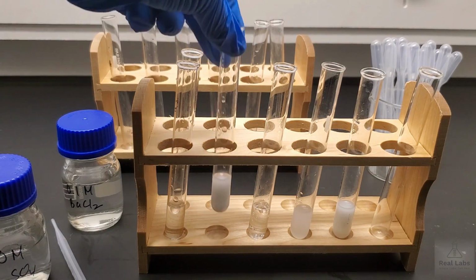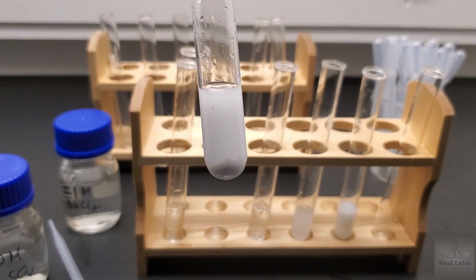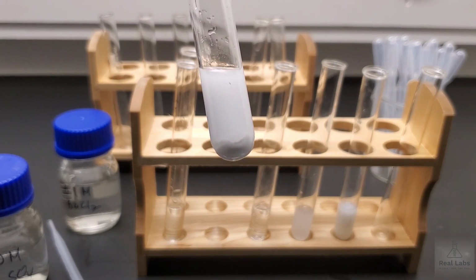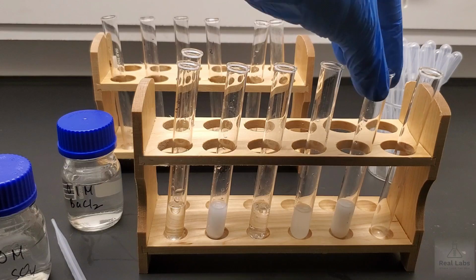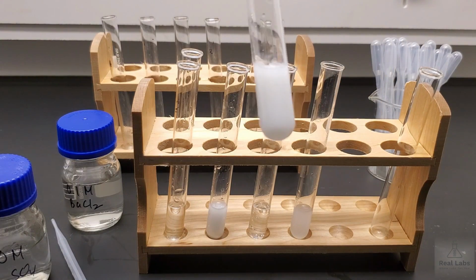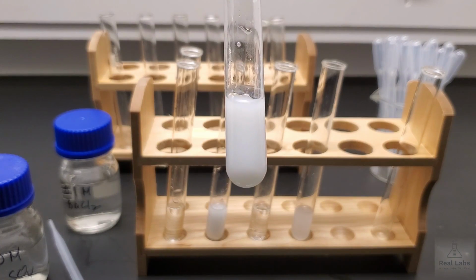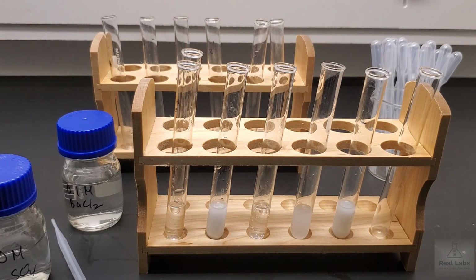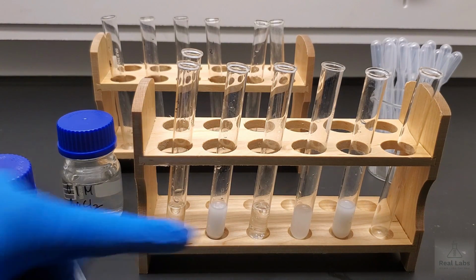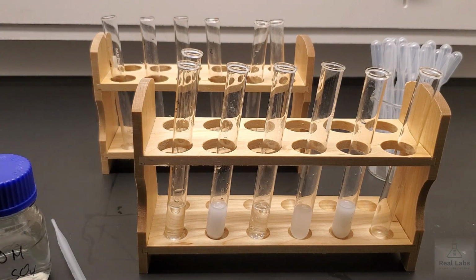If I pick up reaction B that we did a little while ago, you can see there's actually solid beginning to settle out at the bottom of it now. So we can confirm indeed there was actually a solid formed there. If we look back at this one, which is set E, the fifth set, it's still kind of milky and suspended, but that will probably change with time. So when we reacted the barium chloride and the sulfuric acid system, we found a solid forming. And so we're going to put the barium chloride away.